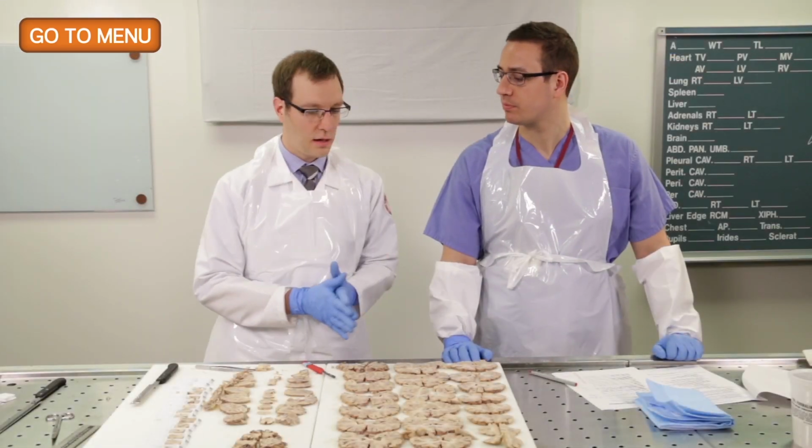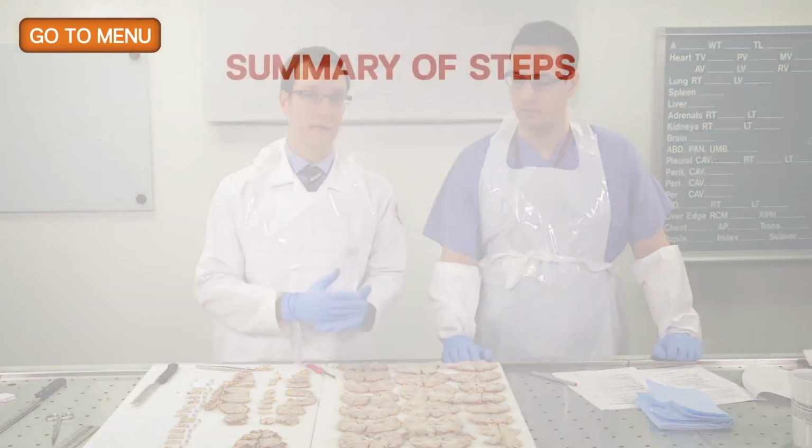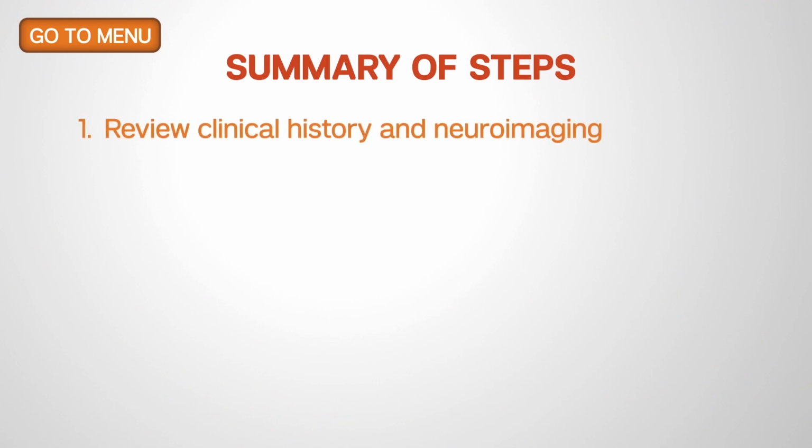So in summary, what we've done here is first, it's important to take the clinical history into account. You certainly, in particular with regard to either neurologic history, cognitive decline, any prior history of stroke. All of these things are very important to come to brain cutting prepared with that history. And certainly if the patient has ever had any neuroimaging, to come prepared with those reports so that you can target these lesions based on the radiology. Certainly you want to try to correlate as best as possible any radiological findings with gross findings in the brain.